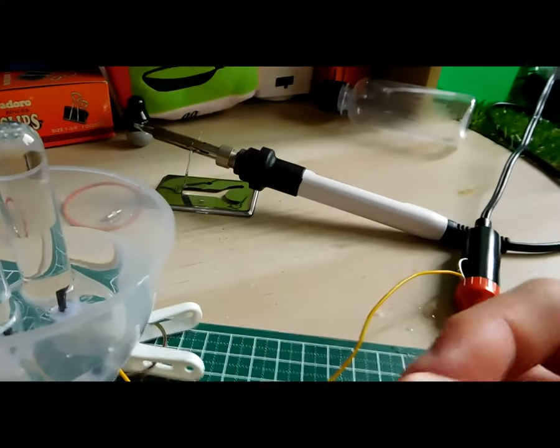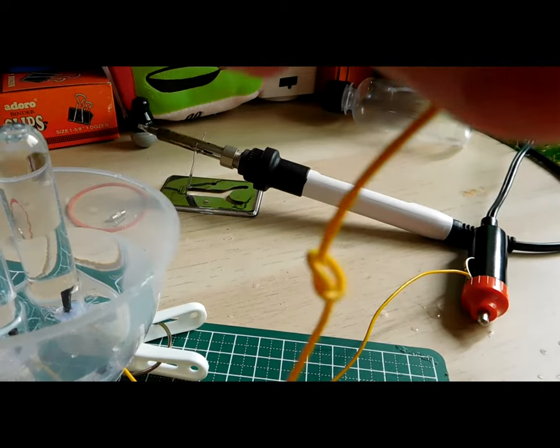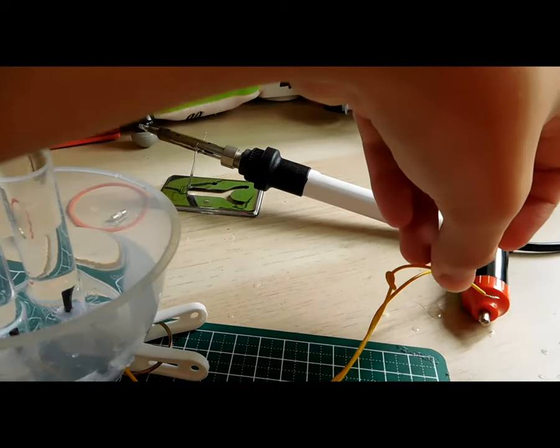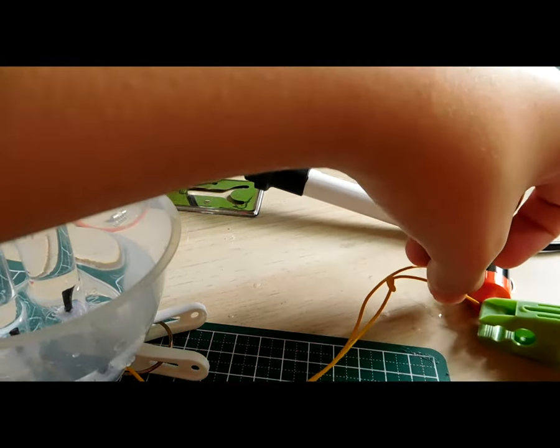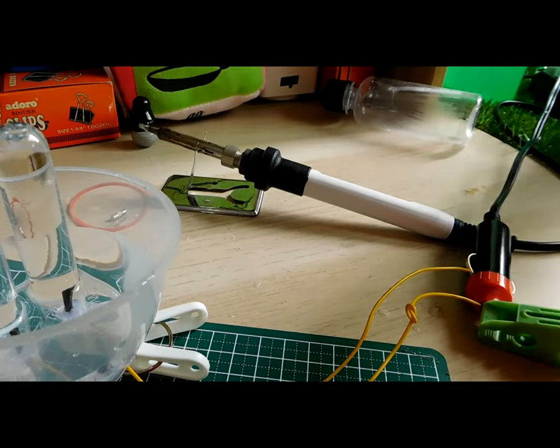Once the two mouths of the test tubes have been fully submerged under the water, what I have to do now is apply a 12 volt DC power source. The wire with the knot is connected to the positive, and the wire without the knot is connected to the negative.